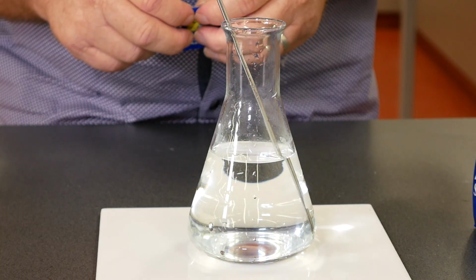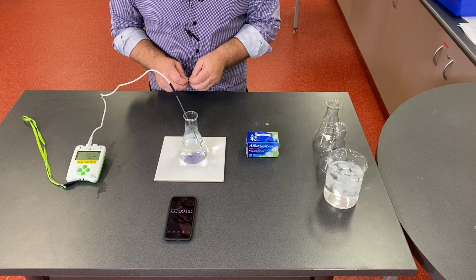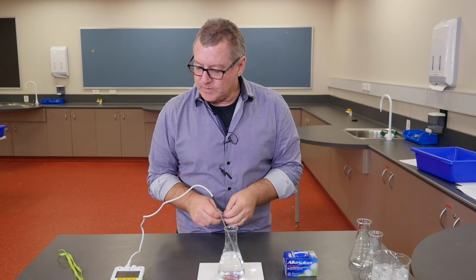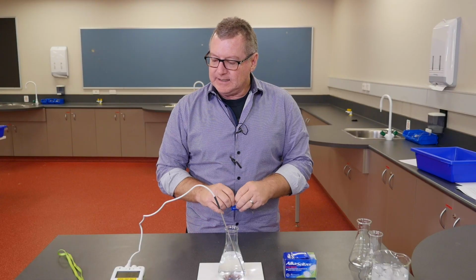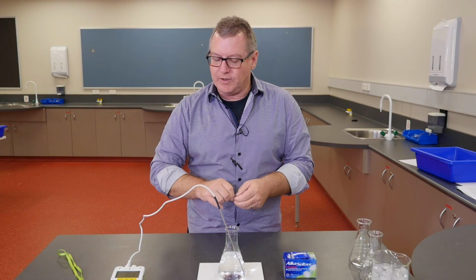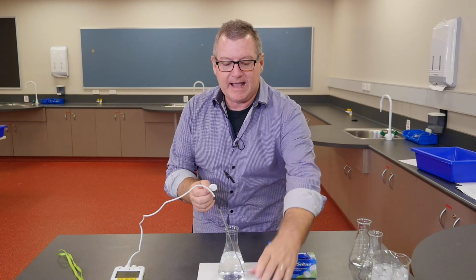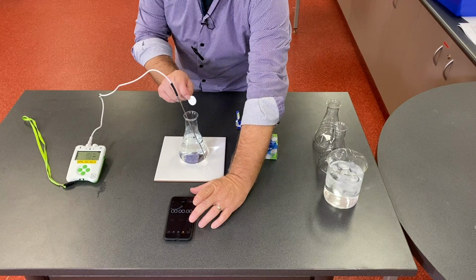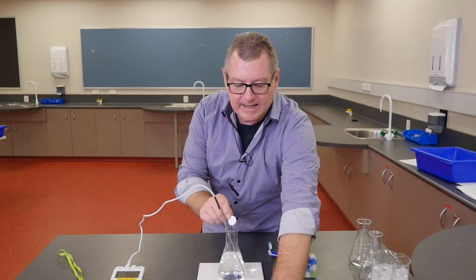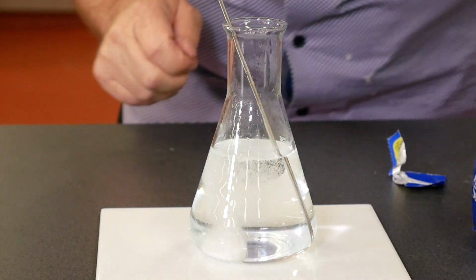So we're using tap water, cold tap water. Our temperature probe tells us 22, just let it equilibrate a little bit, 23 point... That seems to be settling on 23.7 degrees. I'll take the tablet, drop it in, and we're just going to time how long it takes for the tablet, from when I drop it in until it's completely dissolved. So I'll hit the start button at the same time.